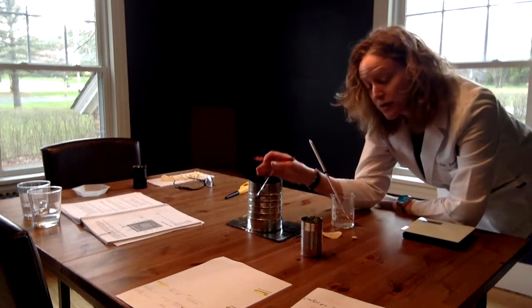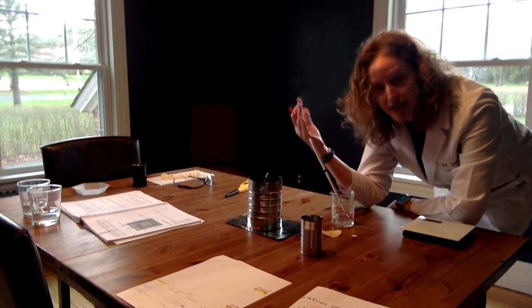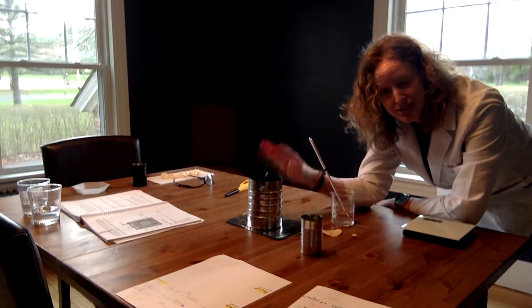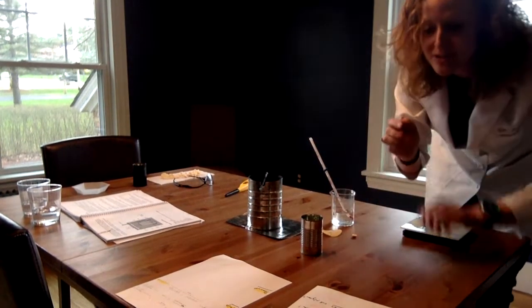As that's rising, let's think about some of the ways that our homemade calorimeter is not as accurate as the bomb calorimeter. I won't tell you the answer, but I want you to start thinking about what some of those ways might be. We are at 33 degrees Celsius, so I'm going to put initial temperature: 33 degrees Celsius.